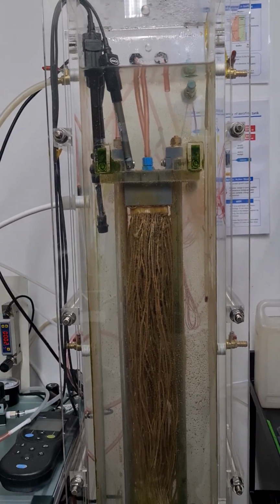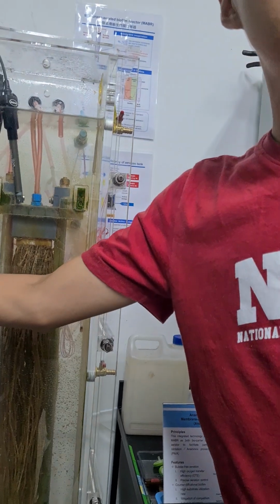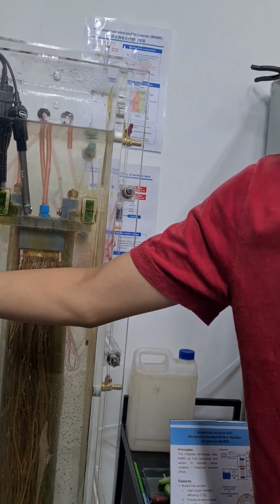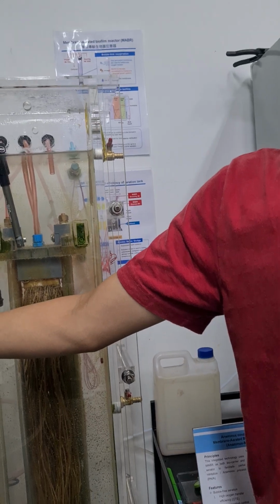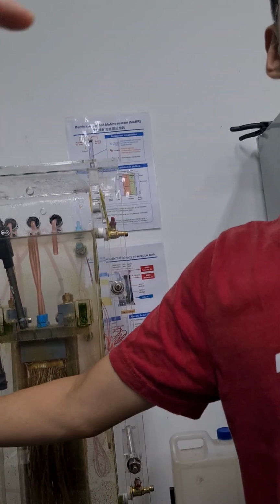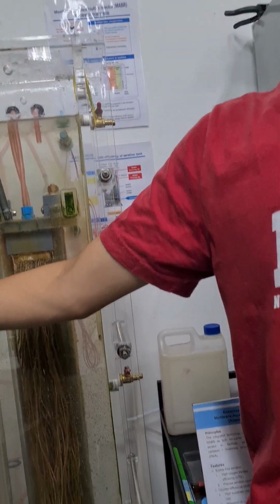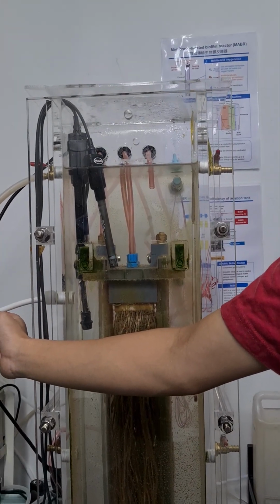Mixed well. We like to have a circulation, for now very slow, and then slowly go up and then down. You don't have to circulate, just one pass, so you have very little space, and we can design it in such a way.